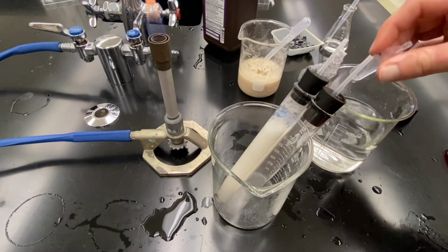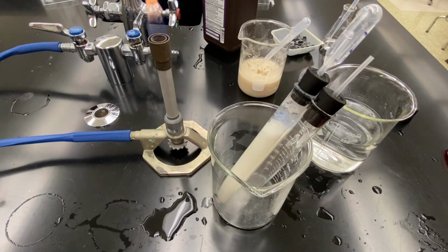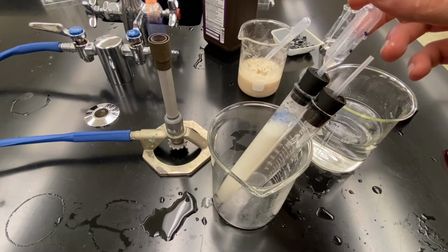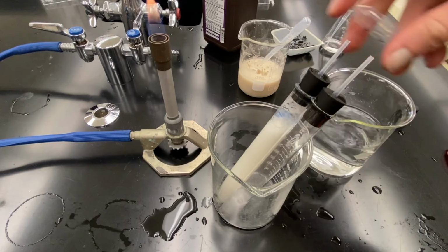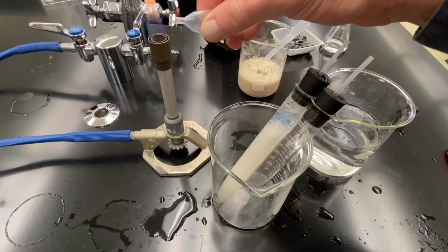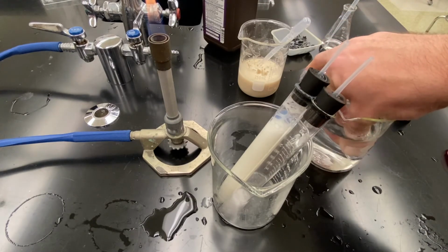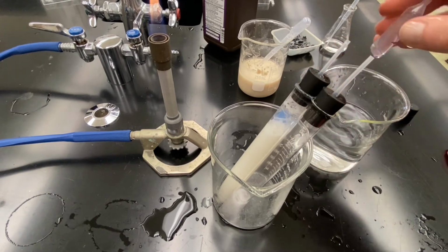And this time I'm going to test the oxygen. So I'm going to put it on the oxygen. Let that fill up all the way. As soon as it pushes out all the water, I can grab it off of there. So I'm going to put my finger over it, and I'm going to squeeze it into the flame. Maybe a very small pop, if any at all. So we could say very small pop or none. And I fill it up with water again.